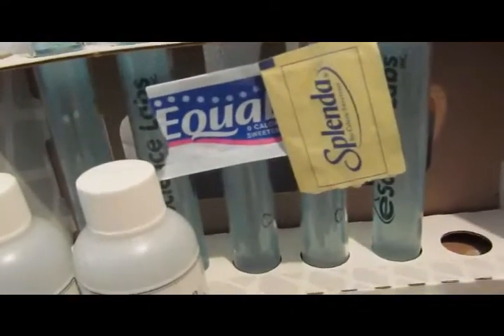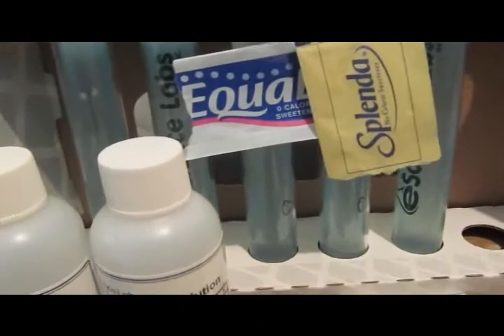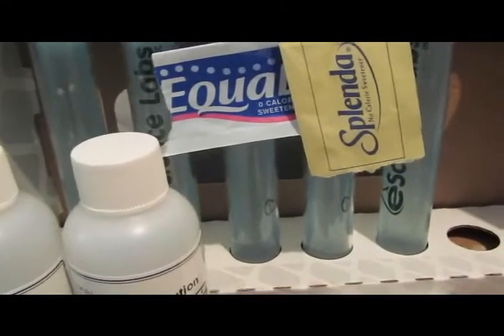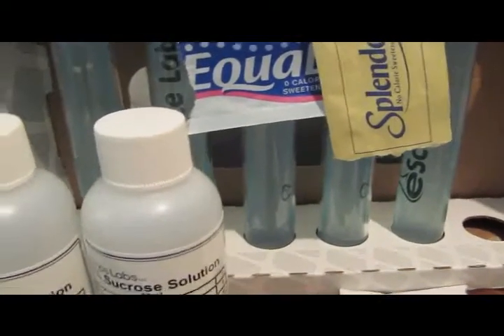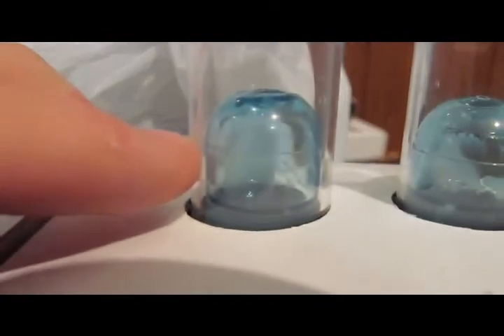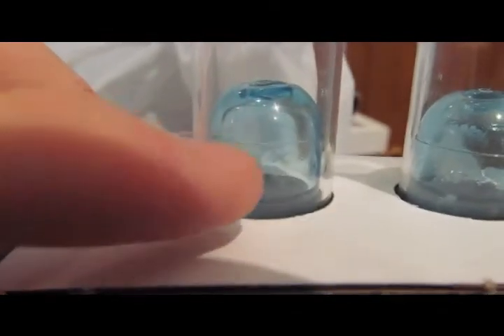This is after, I think about 7 o'clock. I did this at about 3:20 when I got done with it. You can see this was filled - you can sort of see there's a little line.